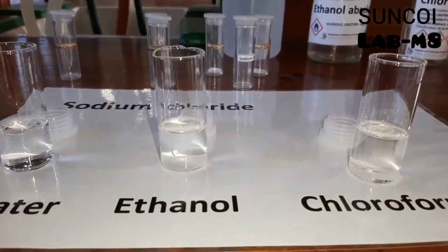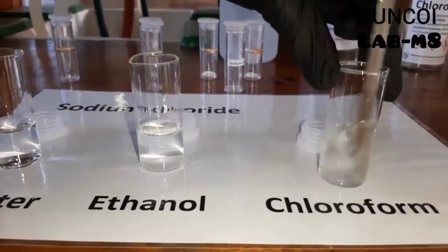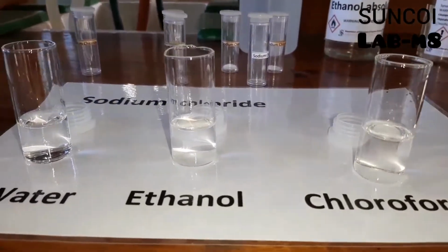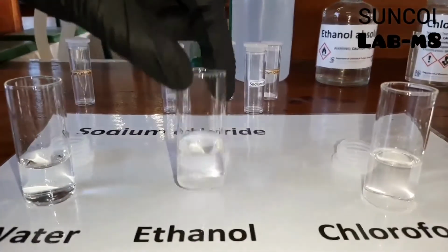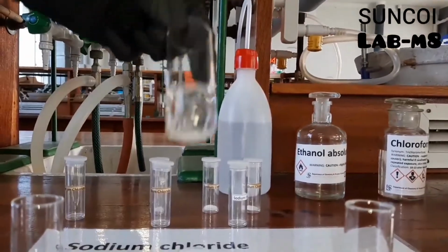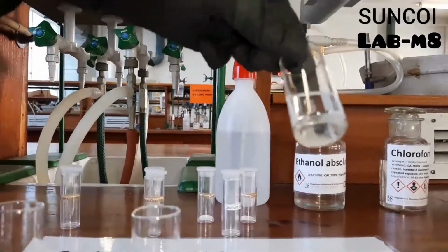So what happened in the ethanol? Did it dissolve? Did it not dissolve? What happened in the chloroform? If you look closely, we are going to show you now. So that's the water. The ethanol, I still see some salt. And the chloroform, I still see some salt.